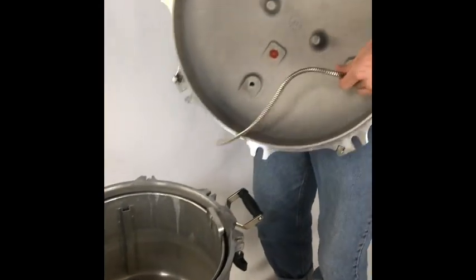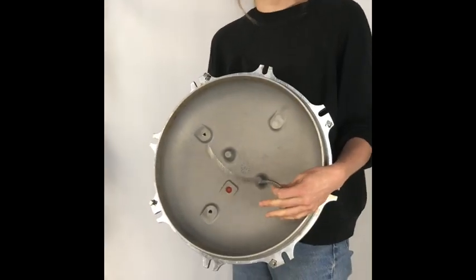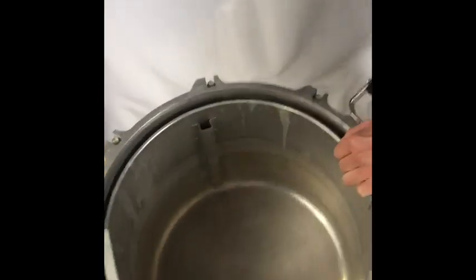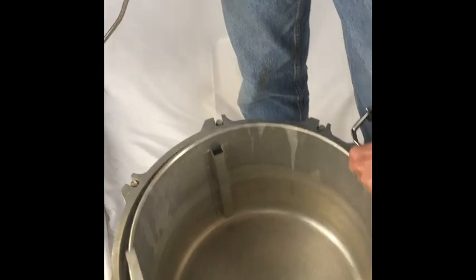A quick note — we actually took the snake off of two of our lids and it runs fine without it. If you do use these little pans that come with it, the snake would feed down in here. But oftentimes we don't use this at all. It kind of depends on what you're cooking.